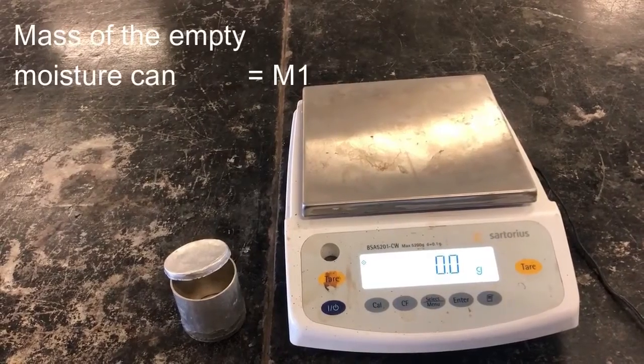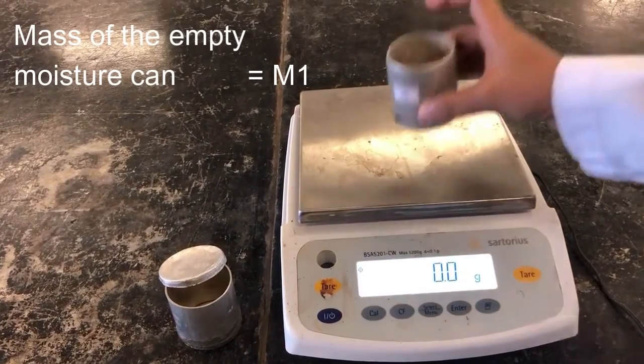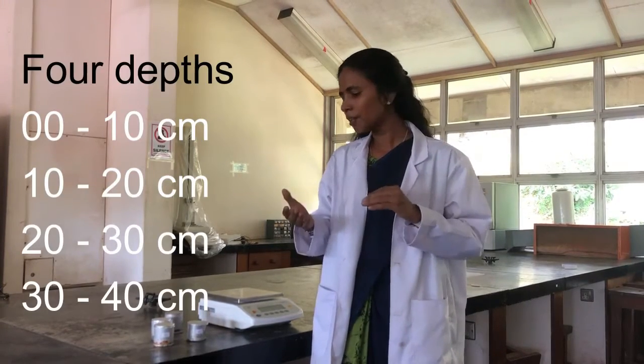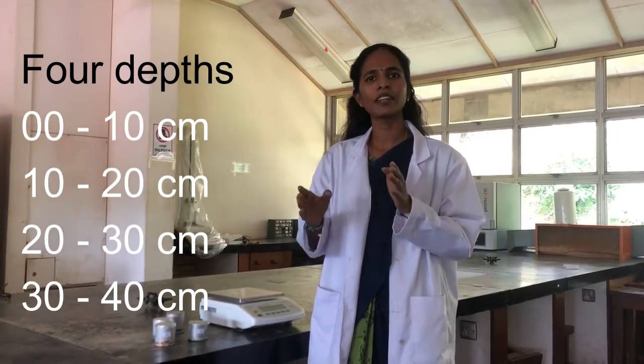First of all, we are going to measure the empty weight of the moisture cans one by one. In this experiment, we are going to collect soil samples from four different depths: 0–10 cm, 10–20 cm, 20–30 cm, and 30–40 cm. At each depth, we collect three samples, giving us 12 samples in total. The number of samples is increased to improve efficiency, accuracy, and representativeness of results.